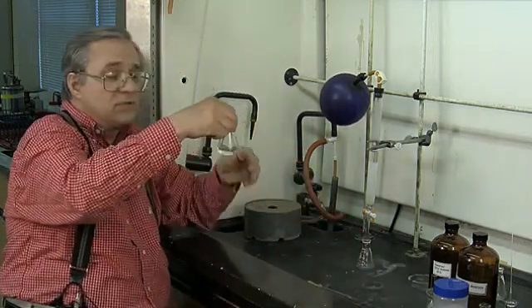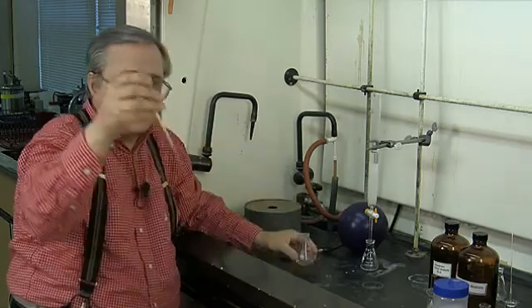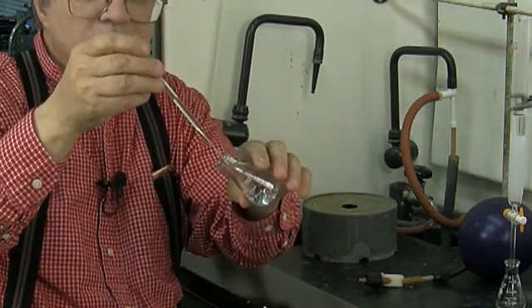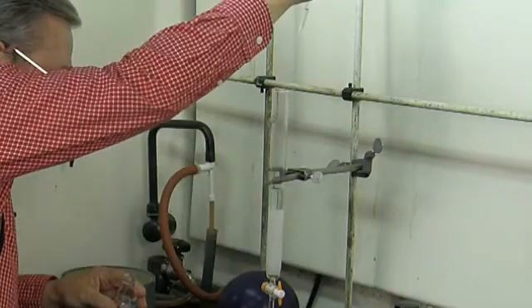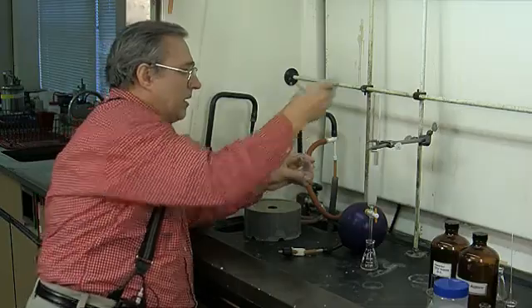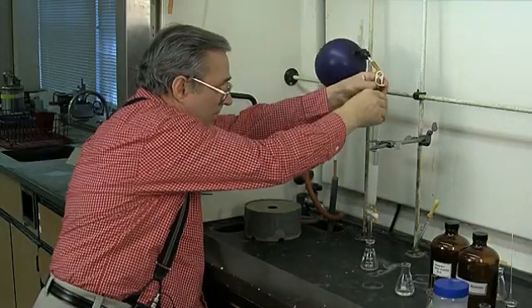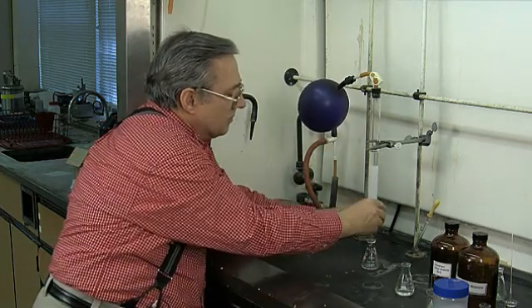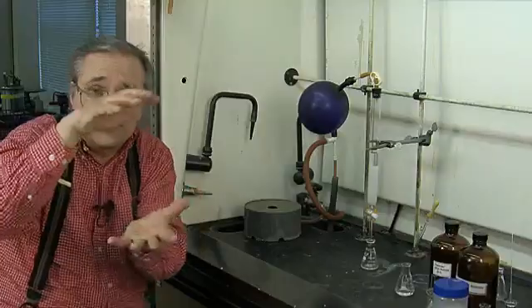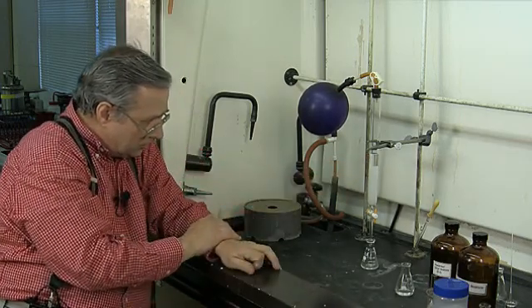I'm going to use a pipette — these are 9-inch pipettes with very flexible bulbs, and you can draw up to 2 milliliters of solvent into them. I'll use that solvent to wash down the hexane/ethyl acetate and silica gel to clean up the column. Start the balloon again — you may have to do this a couple of times. Tap the column a little bit to settle the silica gel into an even layer.